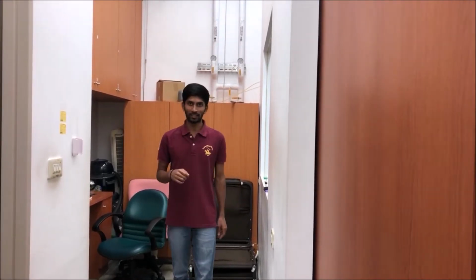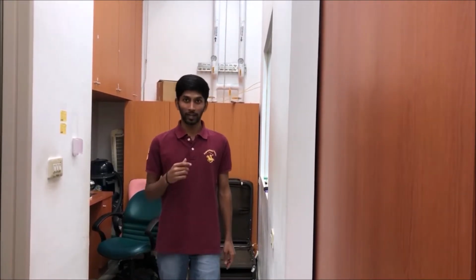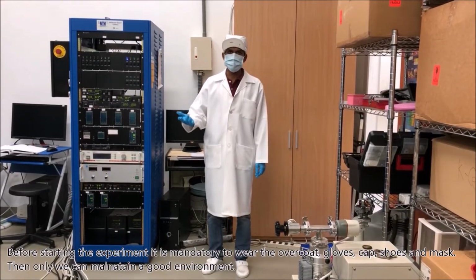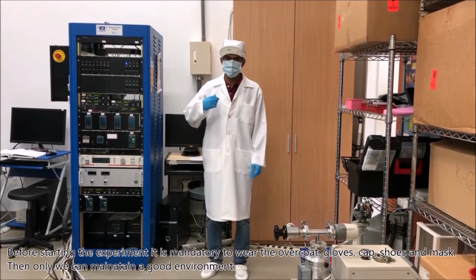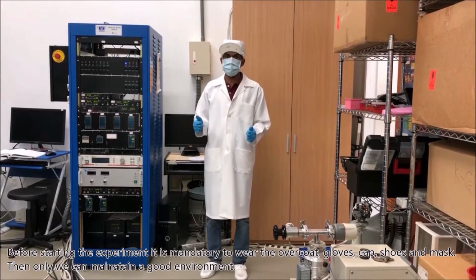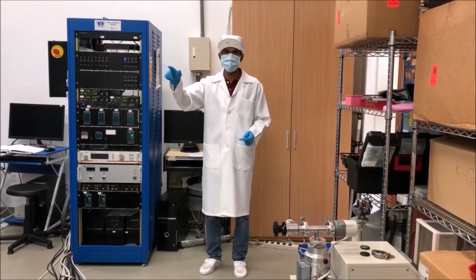Molecular beam epitaxy system uses ultra-high vacuum conditions. In order to maintain good vacuum environment, we should avoid contamination. We do that by wearing necessary clothing. Before starting the experiment, it is mandatory to wear the overcoat, gloves, cap, shoes and mask. Only then can we maintain a good environment.